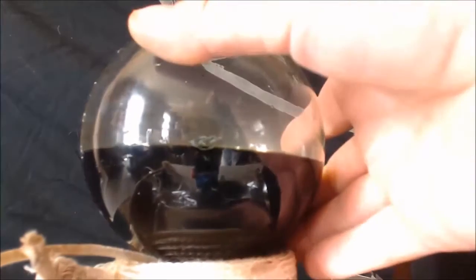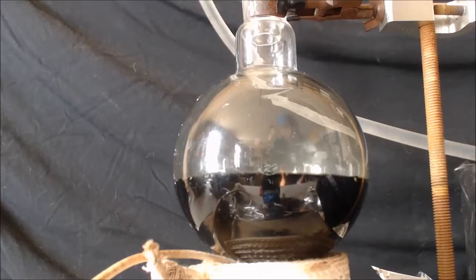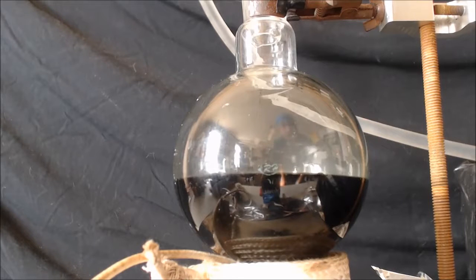Oh it's getting hot, it's getting real hot. It's starting to boil. Alright, well I was going to put the heat on. I guess I can just reflux it with its own heat, so I'm going to reflux this for about an hour, maybe a half hour. I'll get back to you.